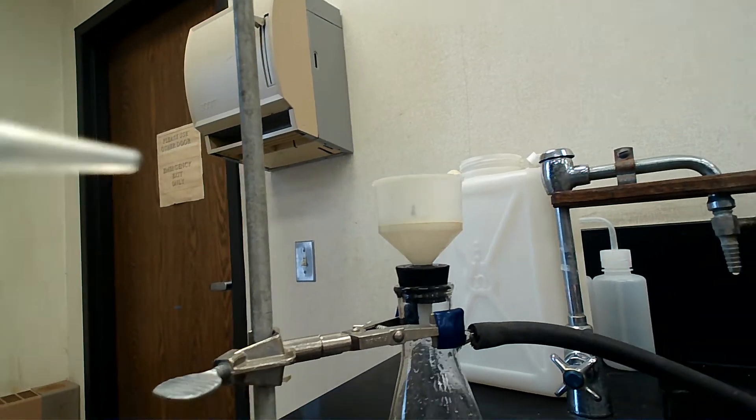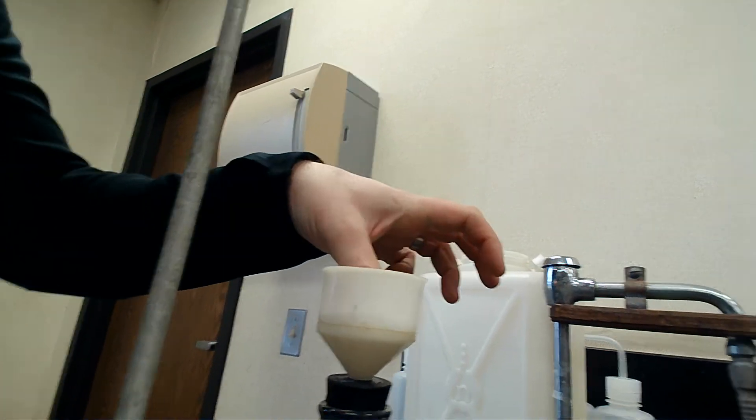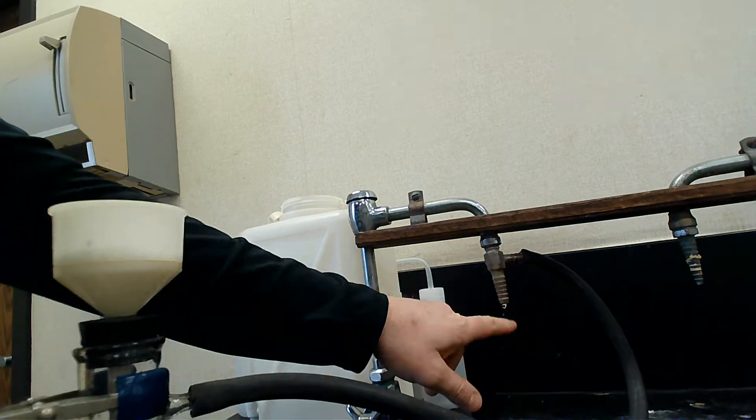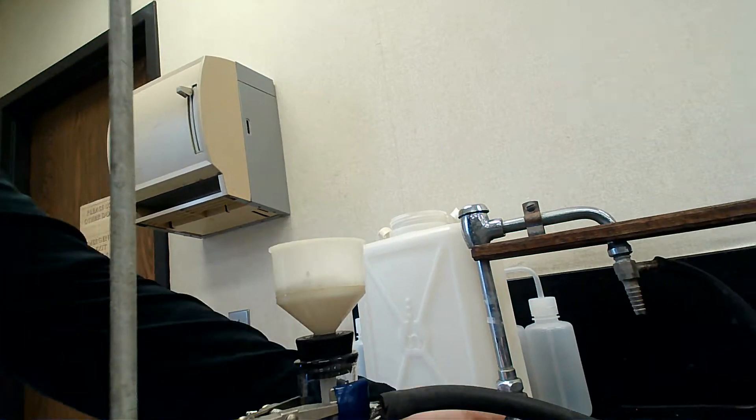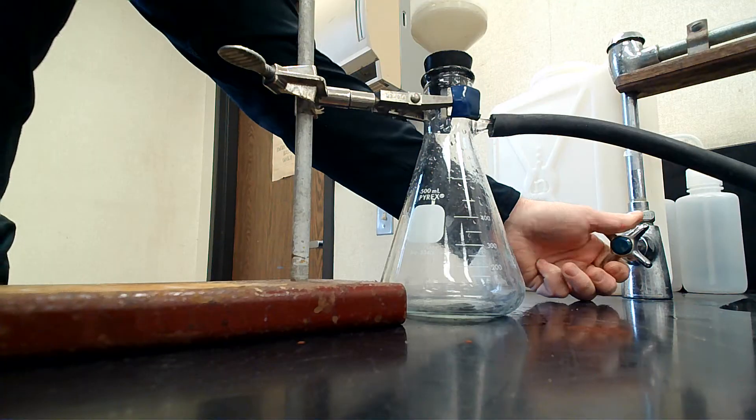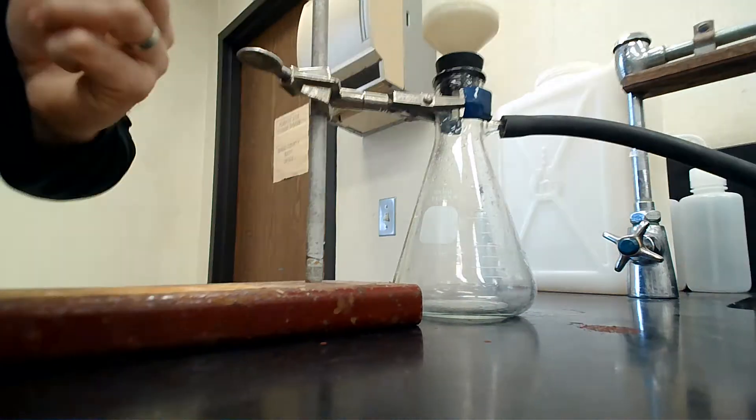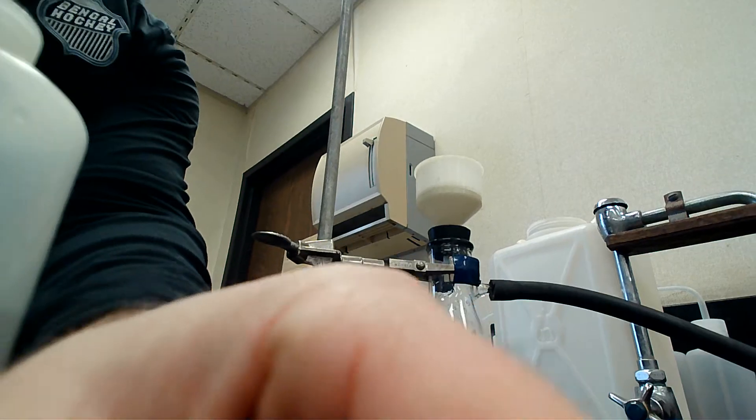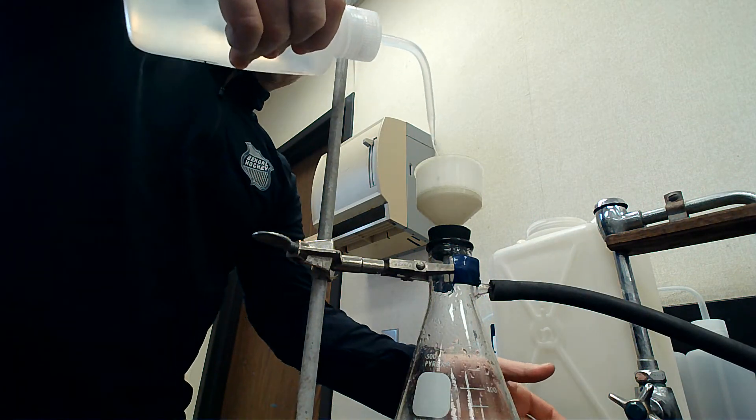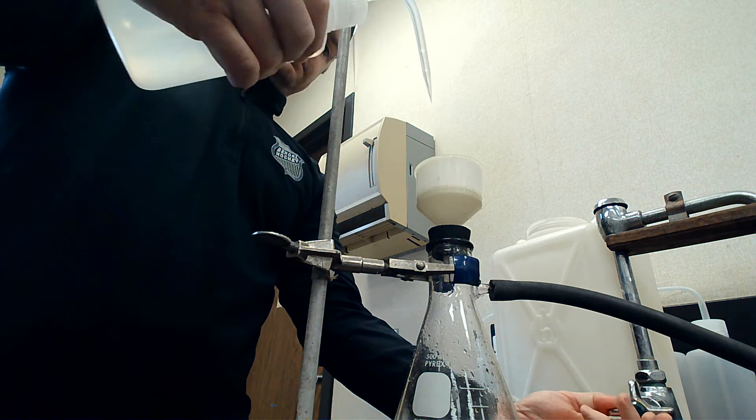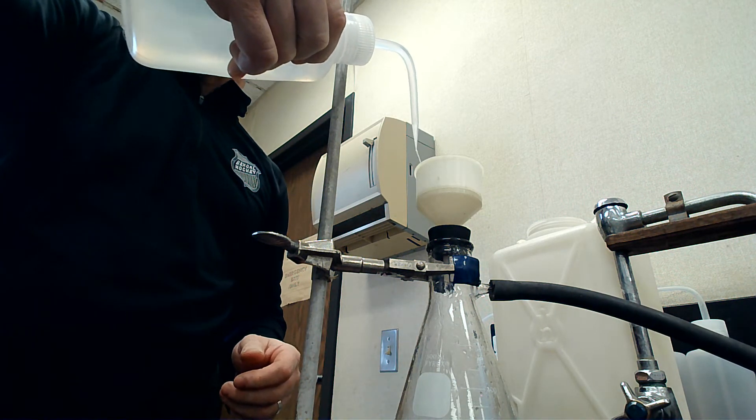It's going to collect the solid. I weighed out this filter paper before. This hose is a vacuum, and it sucks everything through. When I turn it on, we can pull the water—we can pull anything through. You can see the water that I'm spraying in there go through.